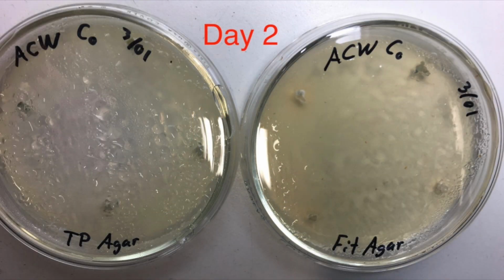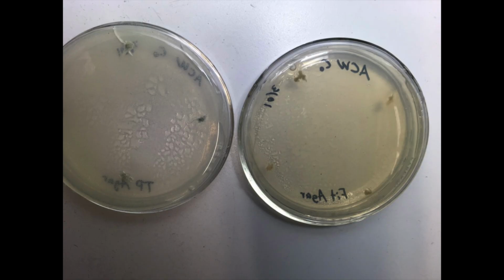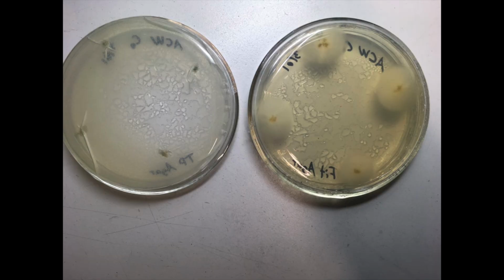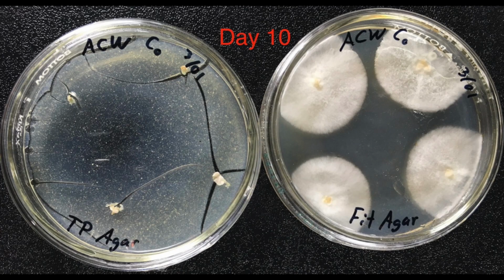I now know that there was something wrong with my bags of telephone agar, but back then I was still proving it to myself. So once I had working agar again, I made a couple side-by-side petries of clone tissue using new fit and old telephone. When cloning, I make 4 samples per plate, and once they grow out, I pick the best looking mycelium to transfer. So there's 4 pieces in each plate of the same tissue.